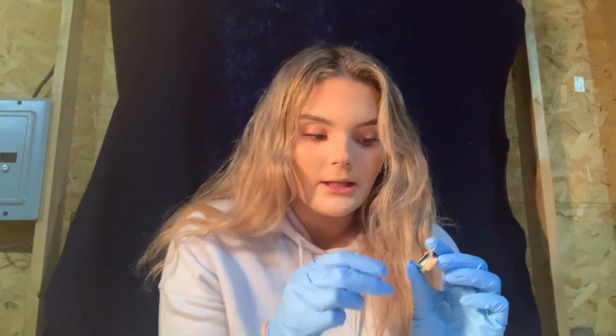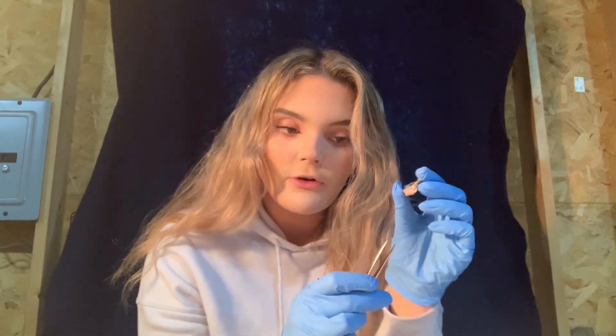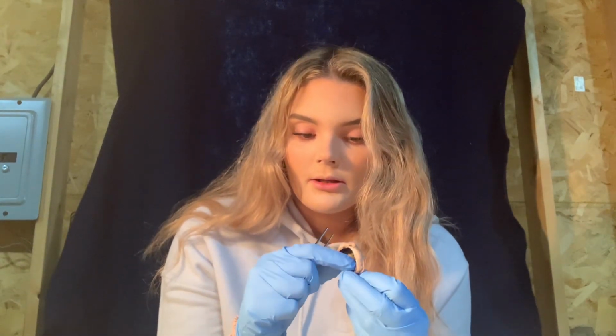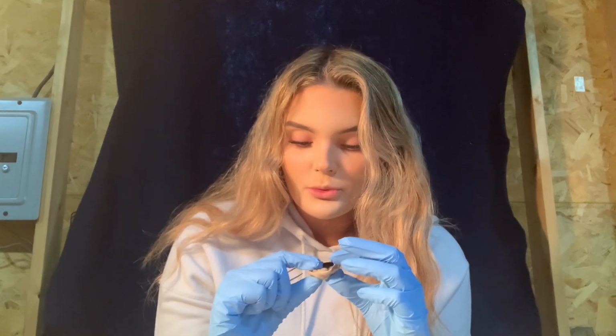Then we'll go to the blind spot. The blind spot is over here, and this is the optic nerve, which sends signals from the eye to the brain, and the blind spot is where the receptor cells converge to form the optic nerve, which is the optic nerve right here. And then the choroid is the thin, dark tissue between the retina and the sclera.